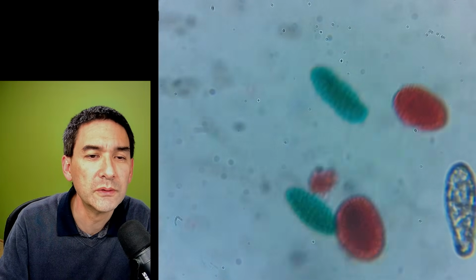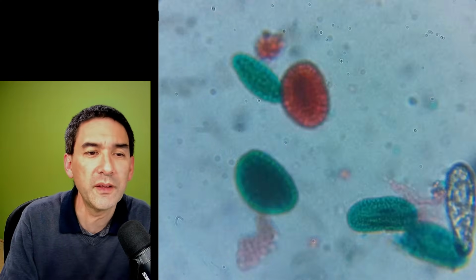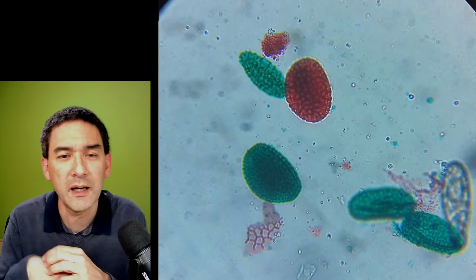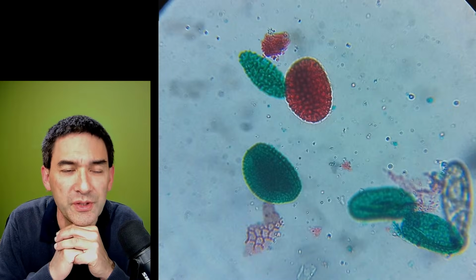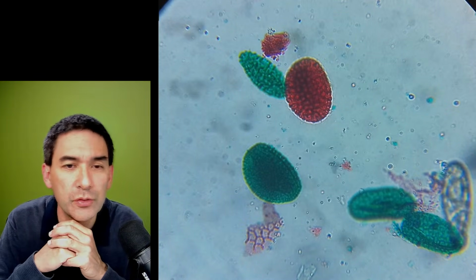Here we go. And you see, that's one of the things that I always find a little bit pitiful, a pity, that I'd like to have a little bit more information about those slides: what the preparation technique was, how it was stained, the mounting medium, and so on. And all of this information is really not included.